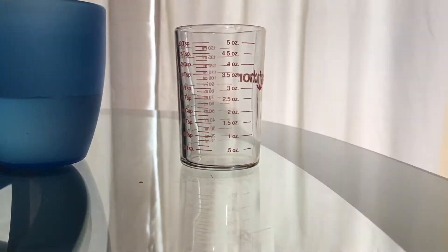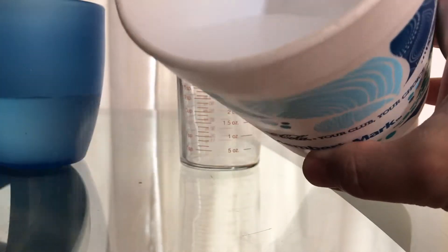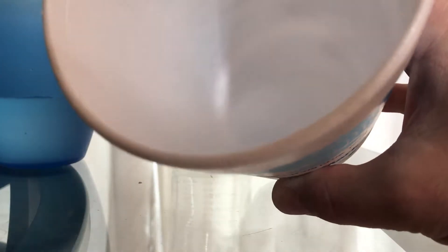For this video, I'm going to be putting liquid oxygen — pure liquid oxygen — in water. Here is the liquid oxygen. Let's see if we can see that nice blue color without dumping it out here. See the liquid oxygen rapidly boiling in this styrofoam.